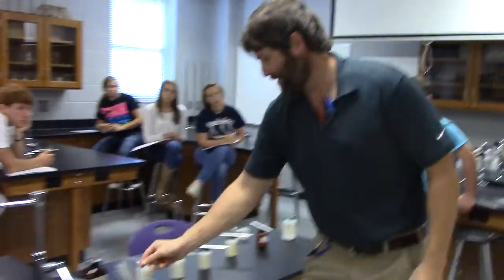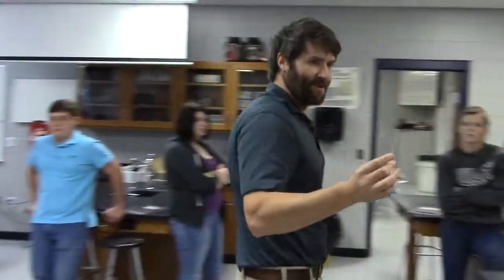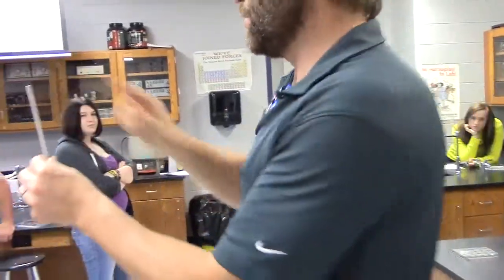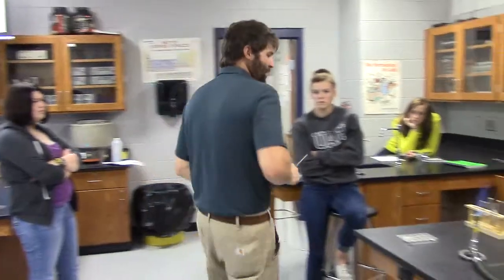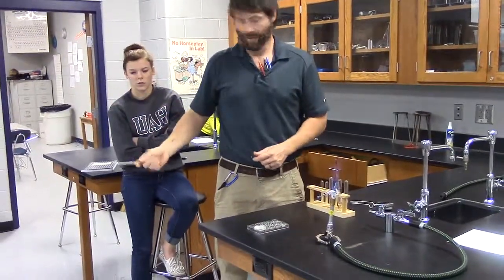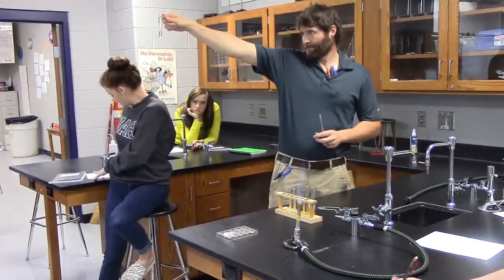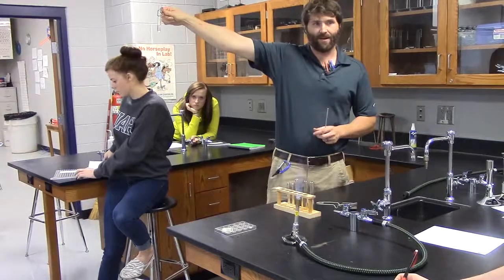Now I'm going to come over. This is what we call a loop. Man, that one's disgusting. I'm trying to find the least nasty one in here. So this is a loop. You can see why you call it a loop. There's a little loop on the very end of it. So step number 1, get one of each of all those, right? Step number 2, get about that much 6 molar HCl, right?